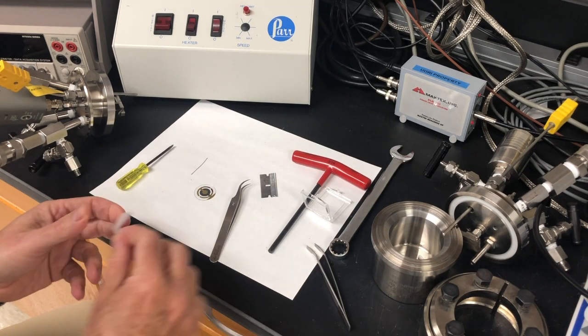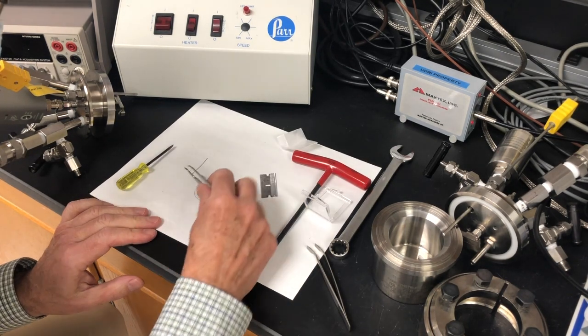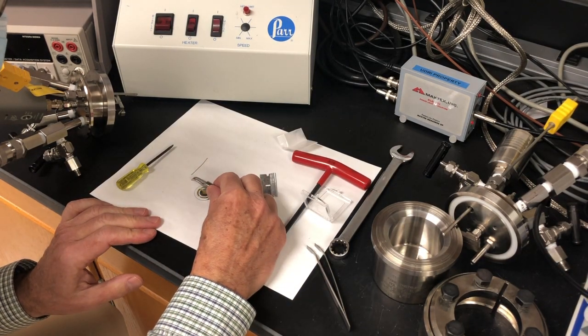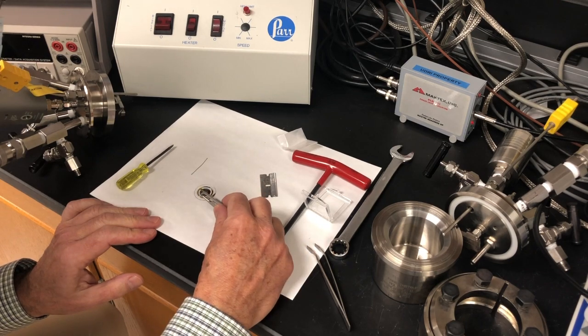And now we carefully place the pieces of indium onto the crystal. The pieces of indium are cut to about a half a millimeter in length and put in the center of the individual electrodes as shown in this photo.